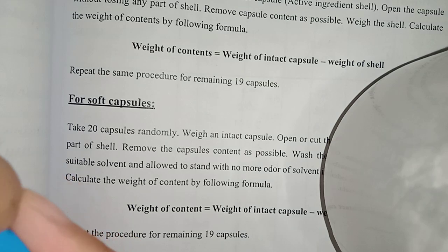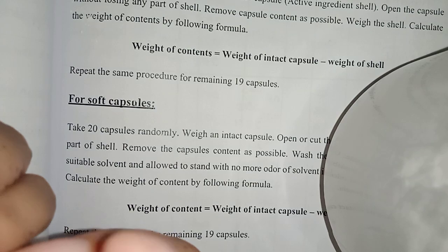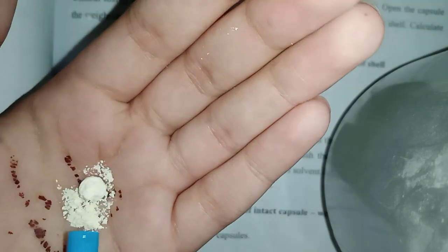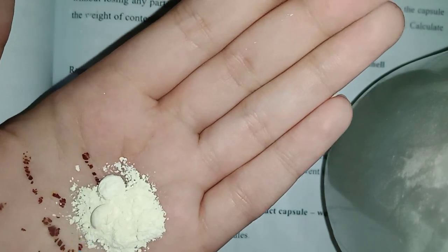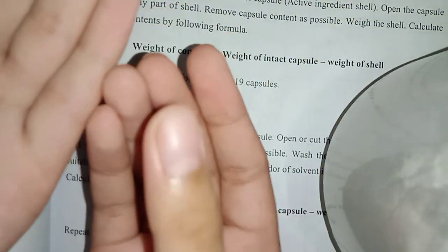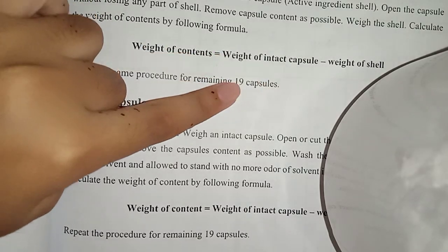Note that some content may remain in the shell, and the shell itself is also weighed. It can be a little difficult to open at warm temperatures. The capsule has a head and a body — this is the entire structure. Remove the whole content from the shell, then take the weight of the shells. Subtract the shell weight from the intact capsule weight to get the content weight. Repeat this process for all 20 capsules.